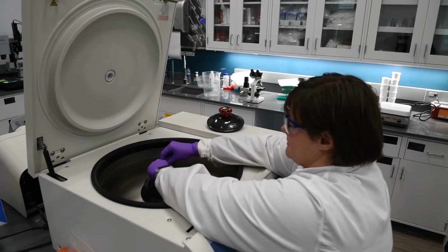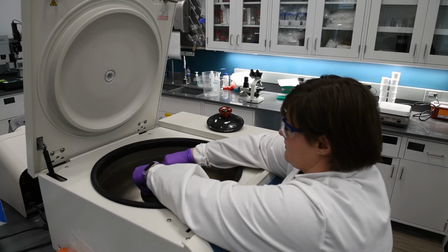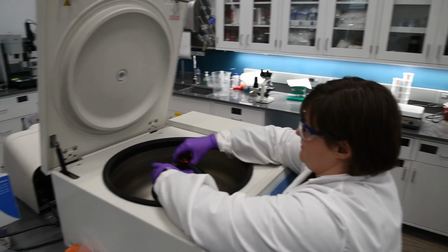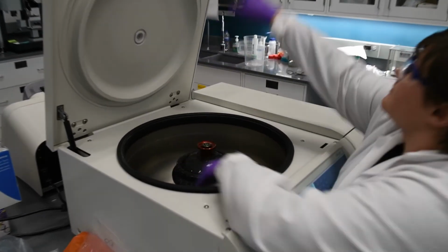What if we could look at the soil pathogens in a soil sample? Winfield United is currently working to do just that. Our first target is soybean sudden death syndrome.